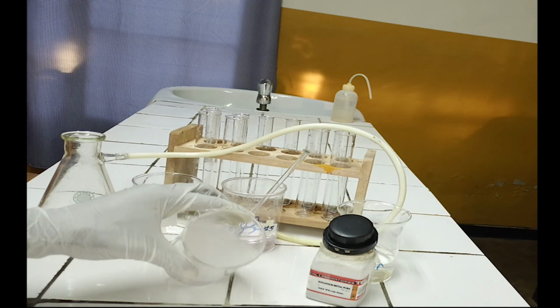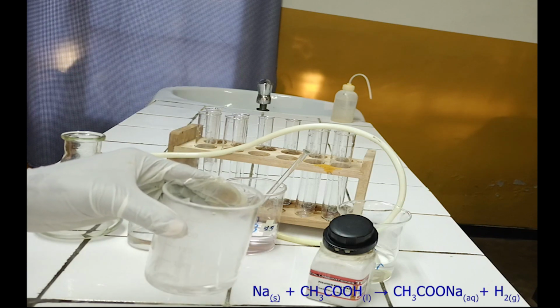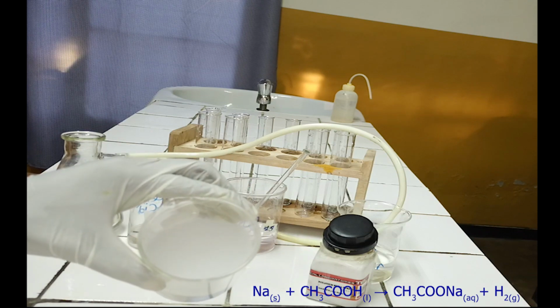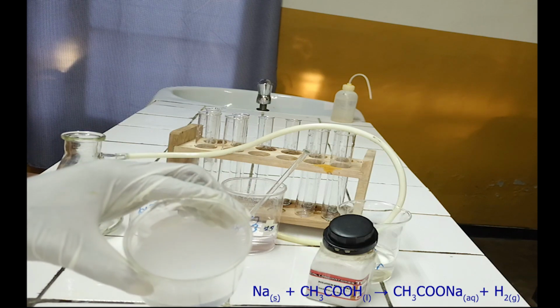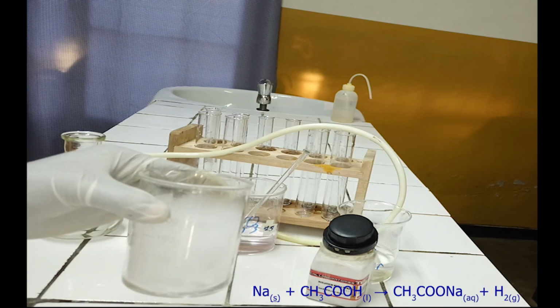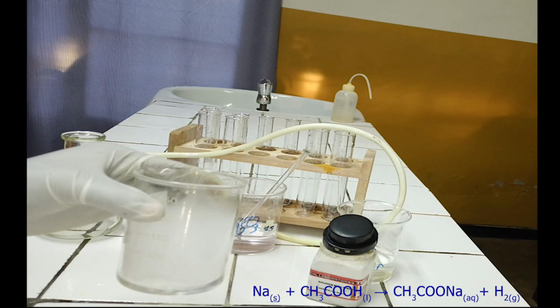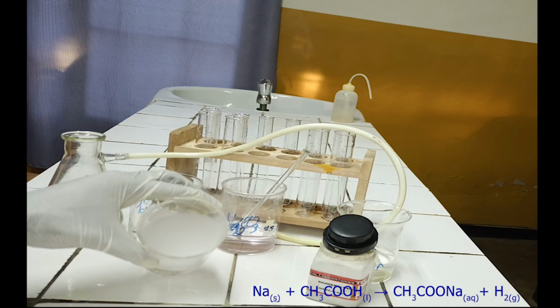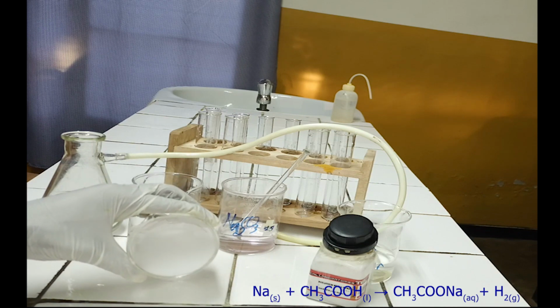As you see, sodium reacts with acetic acid to produce hydrogen gas. Below, there is the chemical equation for this reaction. Organic compounds which react with sodium to form hydrogen gas are carboxylic acids and alcohols.